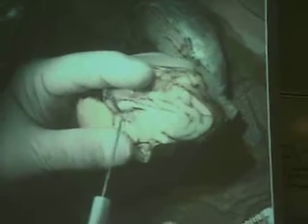All of this outer portion is cerebral. This again is a section, a mid-sagittal section. And you'll notice in this mid-sagittal section, there's a region that kind of looks like a big old white lip. See it? Okay. This is a really large tract.